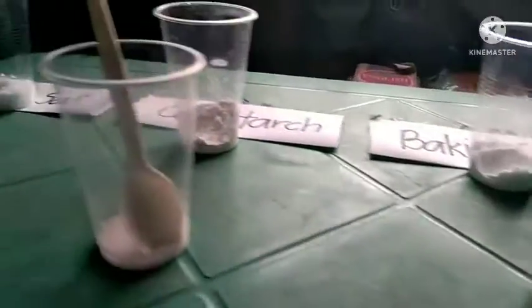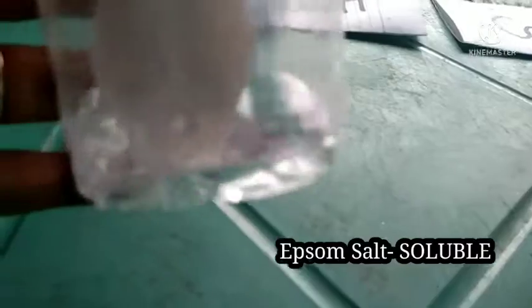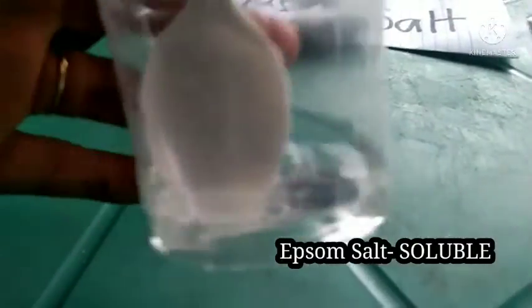So, after stirring and mixing together, here are the results. First, the Epsom salt or the magnesium sulfate heptahydrate. As you can see, Epsom salt is clearly dissolved in water. So, we can say that Epsom salt is soluble in water.